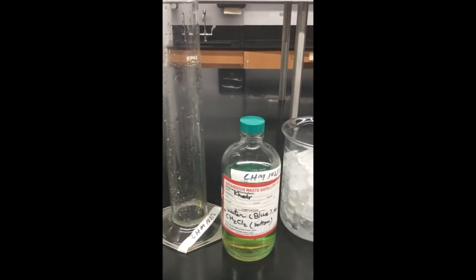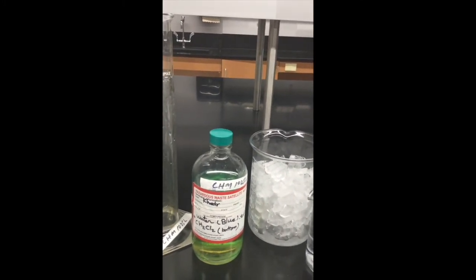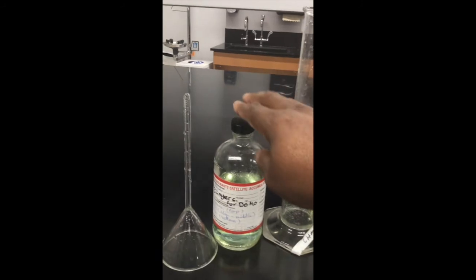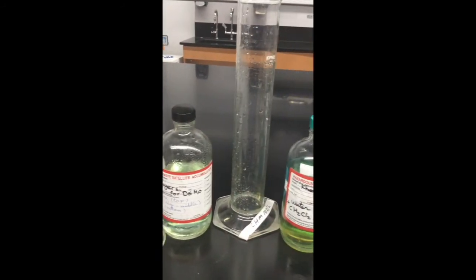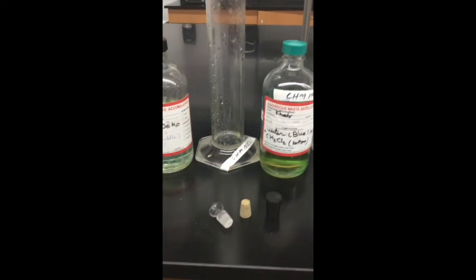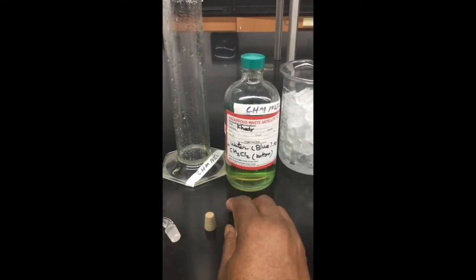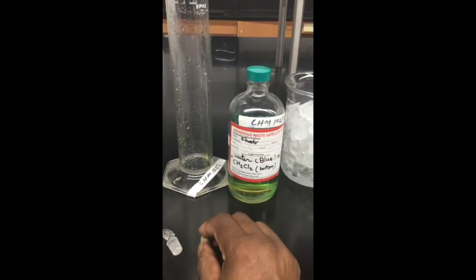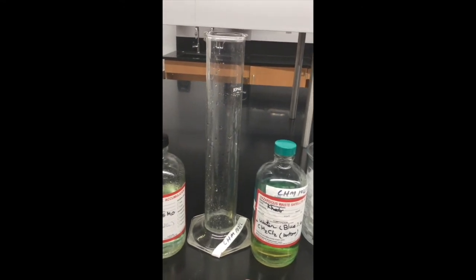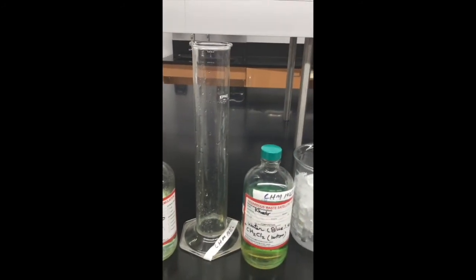I don't have the mineral oil and corn syrup, so you'll change things a little bit in terms of liquid substances. Here is the hexane. All right, this is the hexane liquid. This is the ice, and I don't have the glass marble, but I'll use the glass stopper. This is the rubber stopper and the cork right here. Your job is to identify each liquid substance based on where they will sit in this tall glass cylinder.